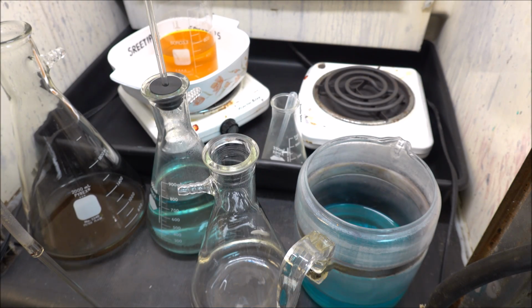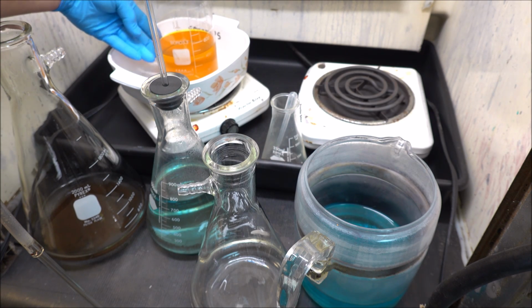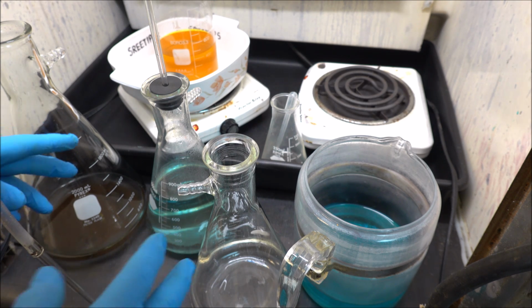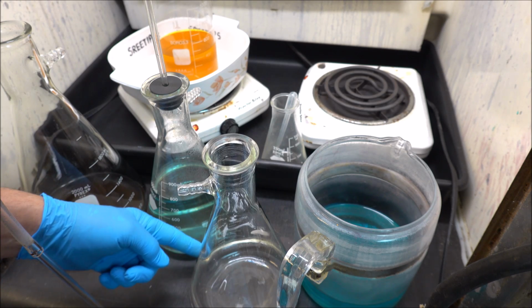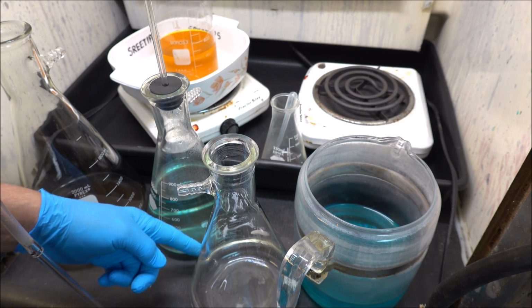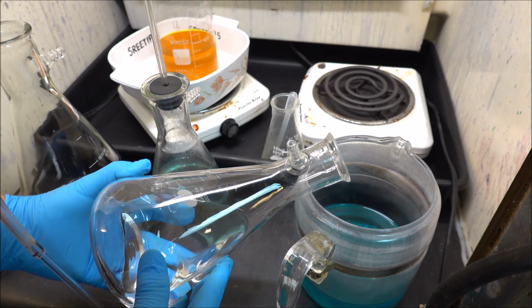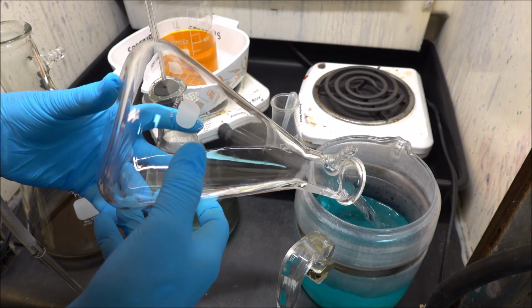It is the following morning. I came out this morning and my solution back here is all settled, nice and clear. But before I go any further, I need some of these flasks for the next process. This is the distilled water hot rinse of the inquarted gold. I don't add any of this stuff to my stock pot because it's going to have silver in it. So I'm going to add it to my silver jar here.